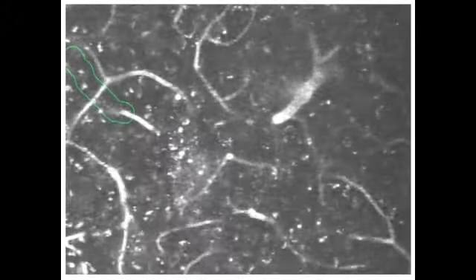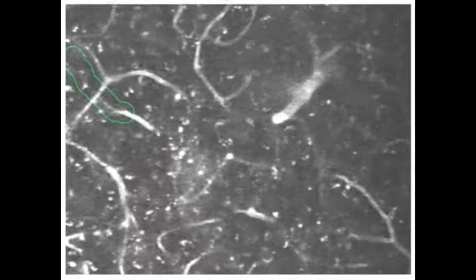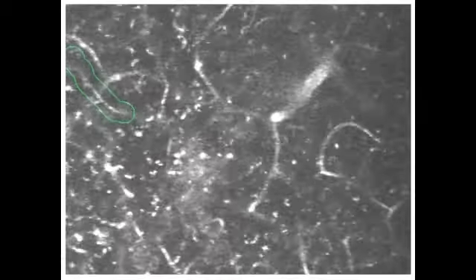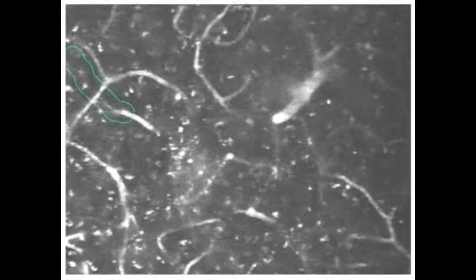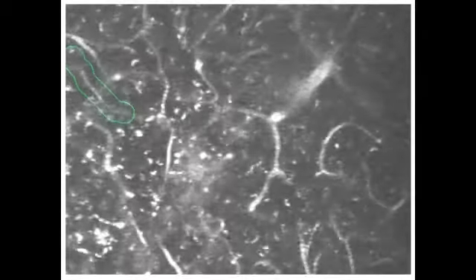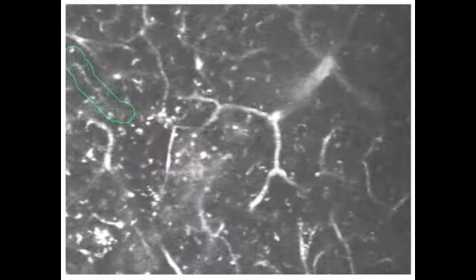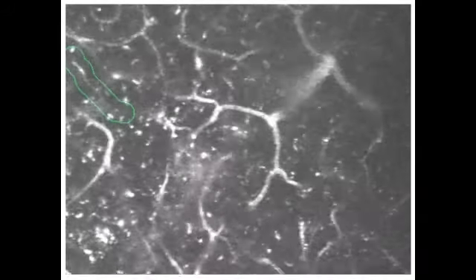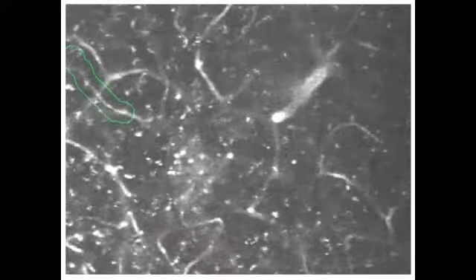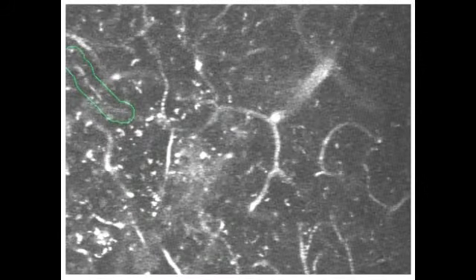It looks like they're clearly moving through the vessel, and we don't see any dark spots that are stuck. If we saw even one single dark spot that was stuck, we would call that a stall. But since all the dark spots we see are moving, this is considered flowing.